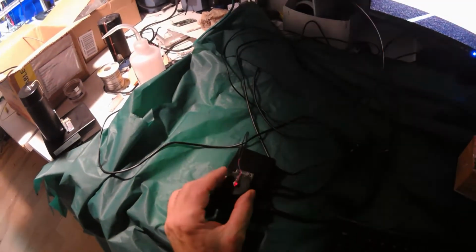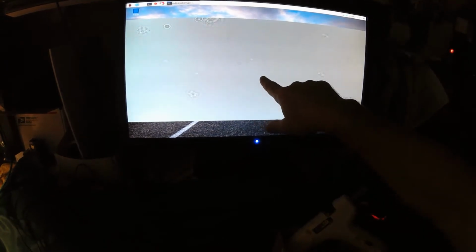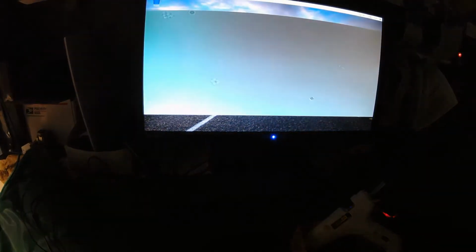Let's start it from the very end. So I'm going to center it, and I'm going to move it off from the center. So that's a pretty nice uniform field. Let me just tweak around. It's bright over here and here and less dim here, but that's pretty good. So it's pretty tolerant. You can see I'm moving it about a half an inch, and there's still a good range. So I'm going to pick right there.